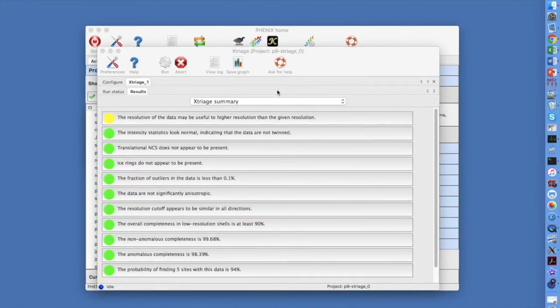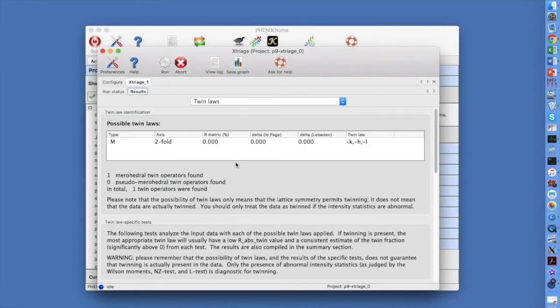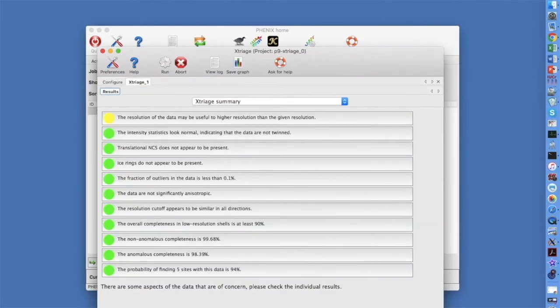We can find possible twin laws in the pull-down menu. For this space group and cell dimensions, there is one merohedral twin relationship with a twin law of -k, -h, -l. If there were twinning, you would use this twin law in refinement. Now let's look at our anomalous data. The traffic light says the probability of finding 5 sites with this data is about 94%.